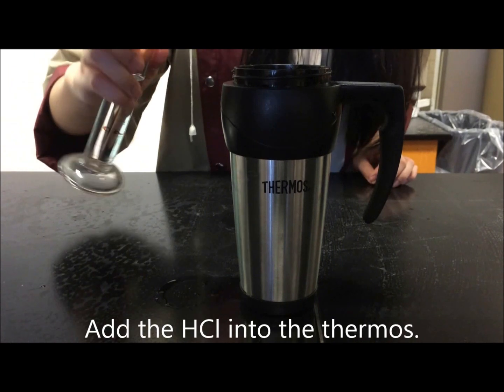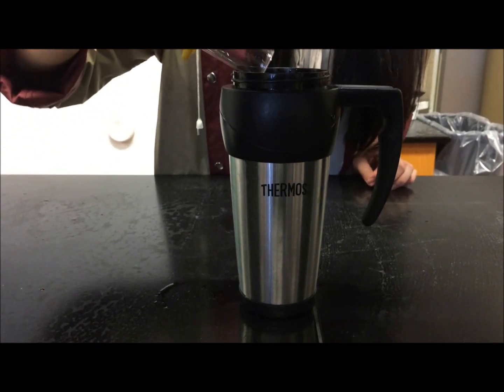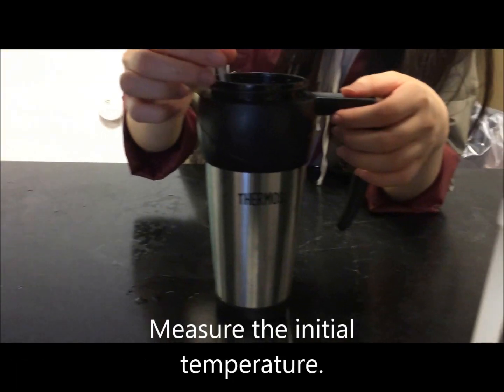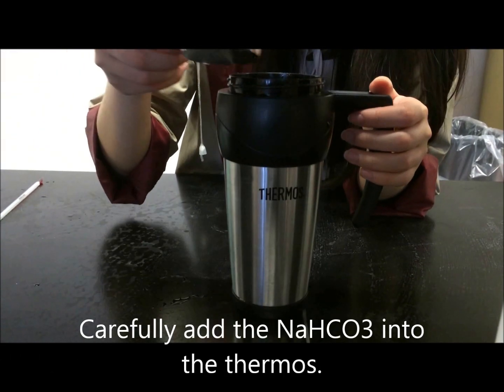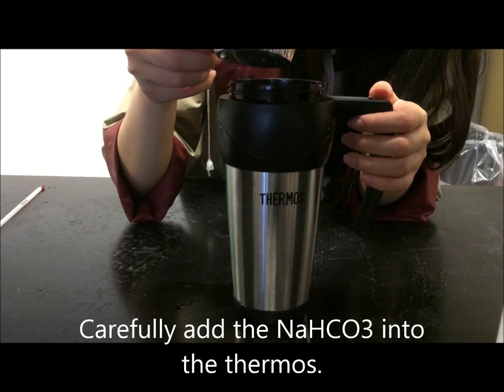Add the acid into the thermos. Measure the initial temperature. Carefully add the sodium bicarbonate into the thermos.